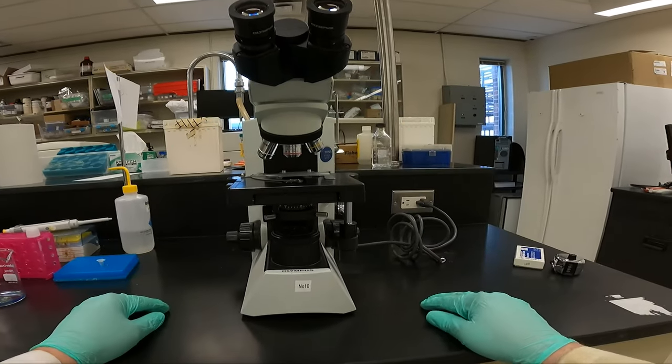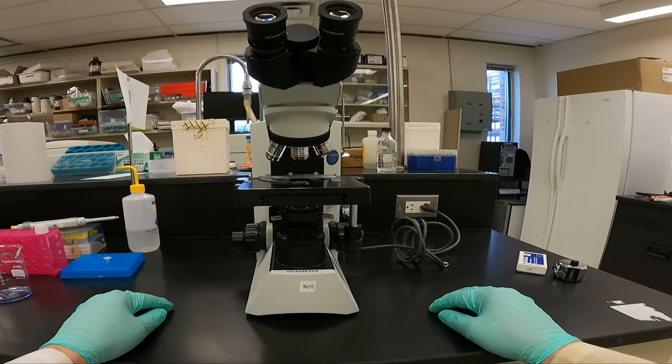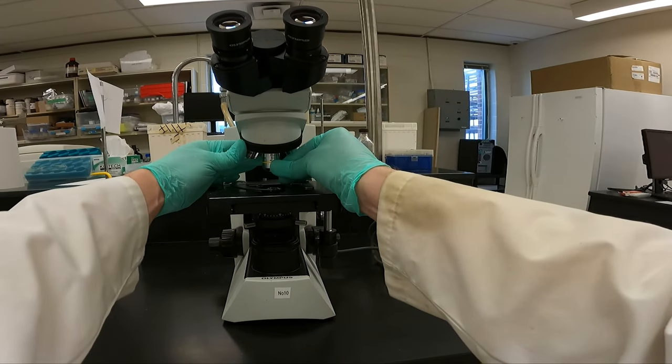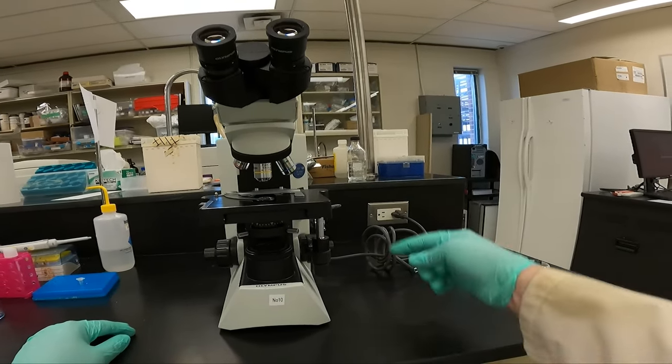Always start on low power magnification. Then switch up to medium power when using the hemocytometer.